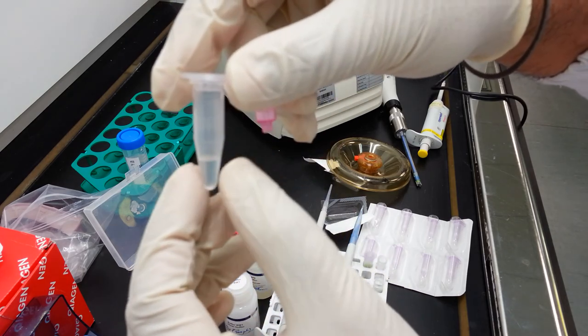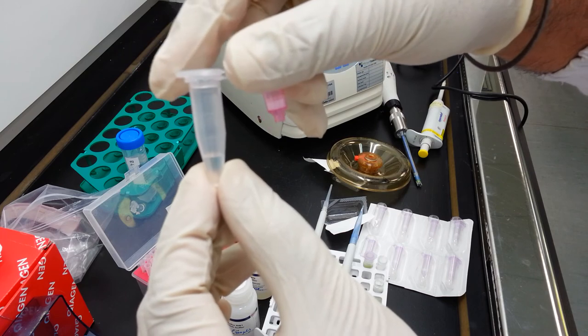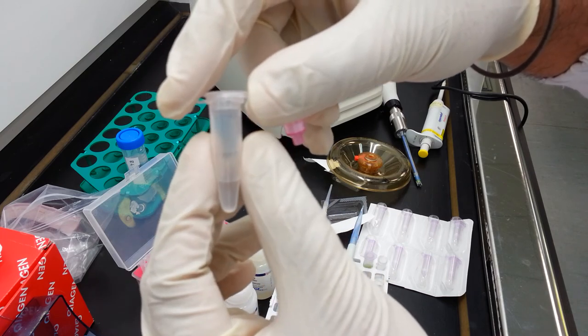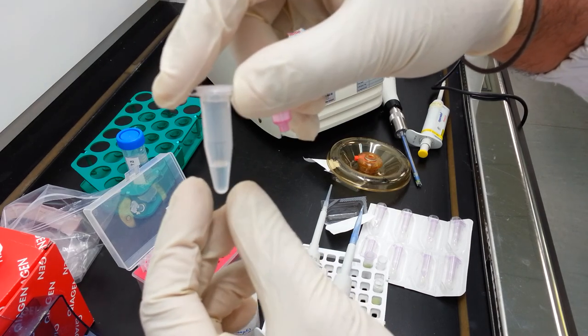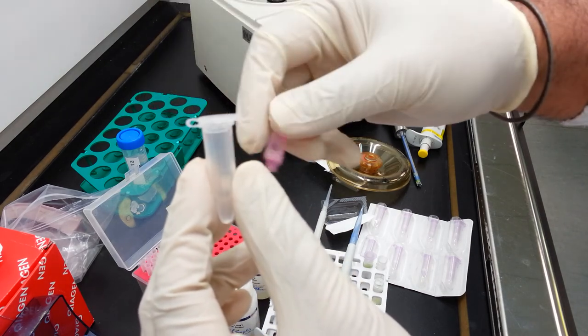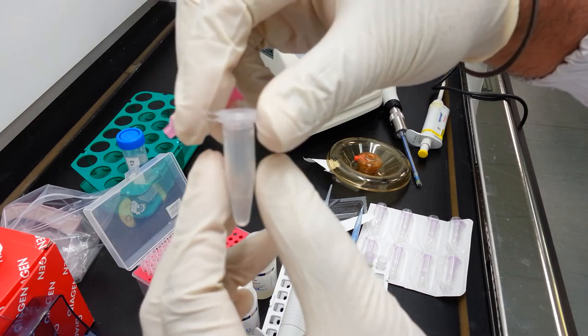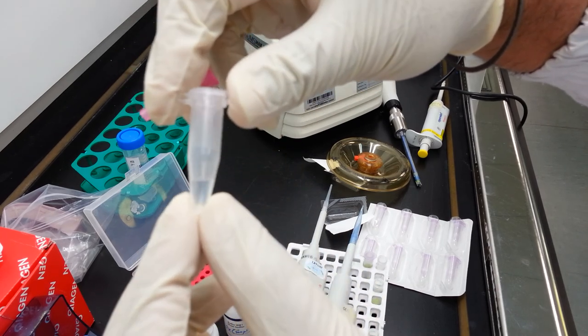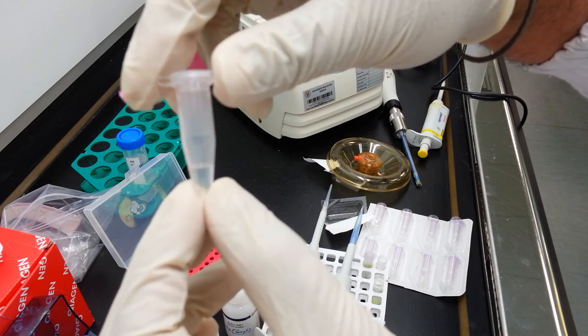Downstream processing of RNA involves testing of the quality using a spectrophotometer, followed by cDNA synthesis, and sequencing.